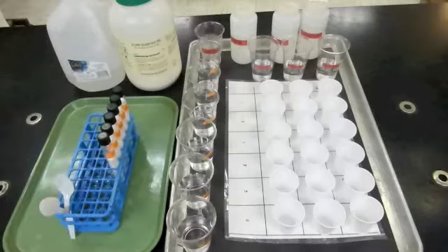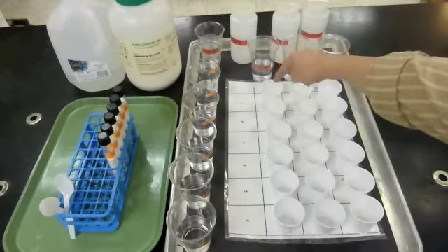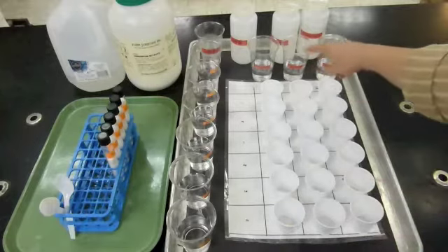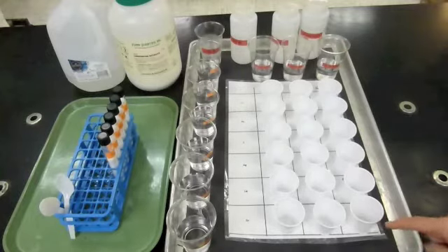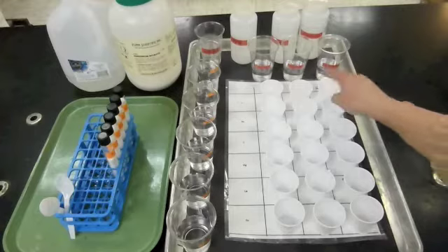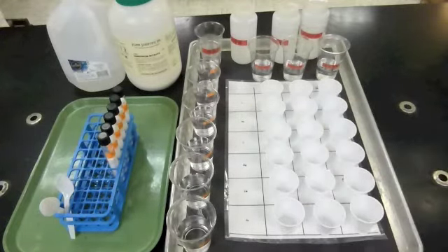Then what you'll do is you'll take the mixtures and pour the chloride solution into all of the cups that are in the same row with chloride. Pour some of the carbonate into all of the cups that are in the same row with carbonate. Pour some of the phosphate into all the same cups in that row. And then the lithium will pour into the 3 cups that are labeled for lithium, and then 3 for sodium, 3 for potassium, and so on, until we've made all the possible mixtures.